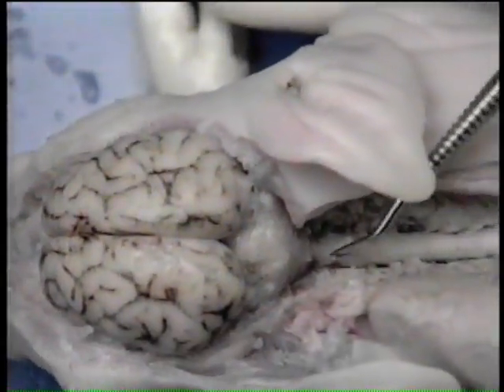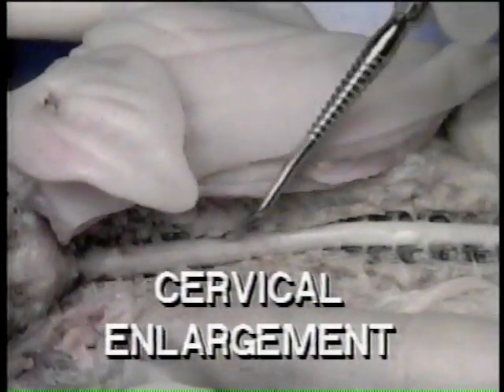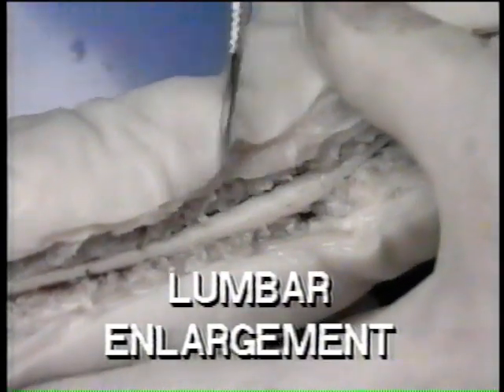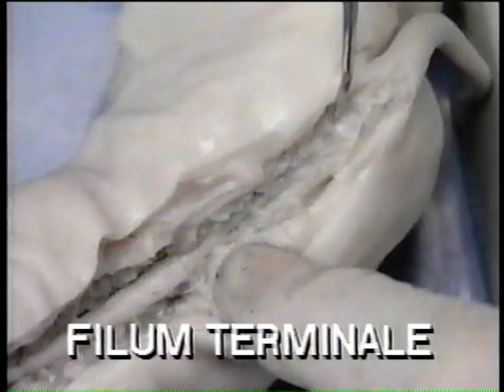The spinal cord is enlarged at the level of the forelegs, the cervical enlargement, and at the level of the hind legs, the lumbar enlargement. The spinal cord narrows at its caudal end to form a thin strand called the filum terminale.